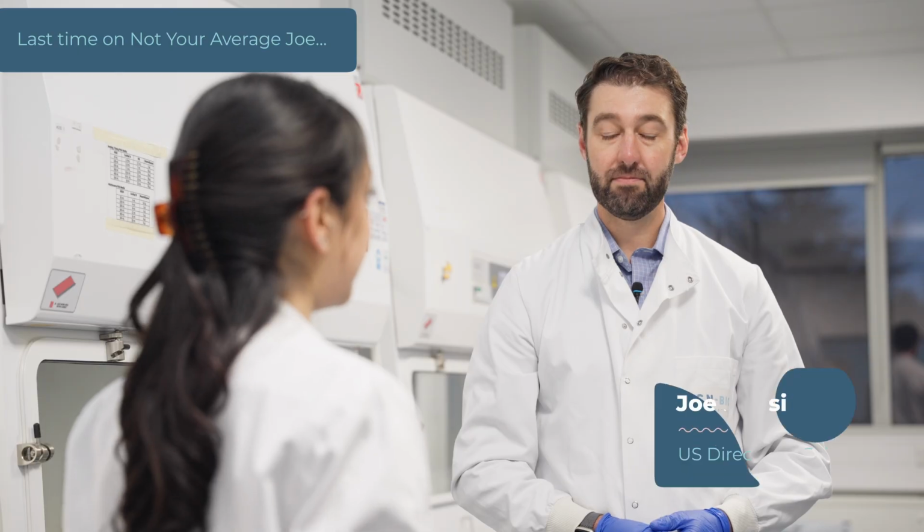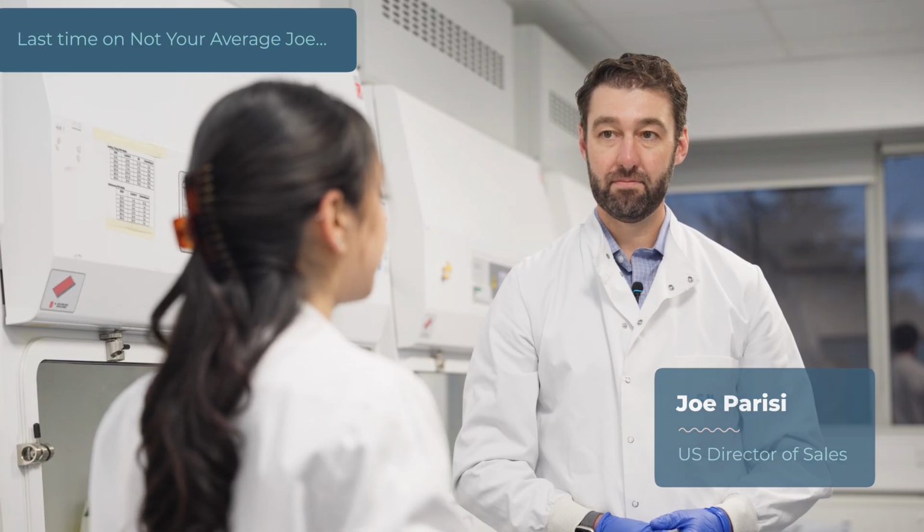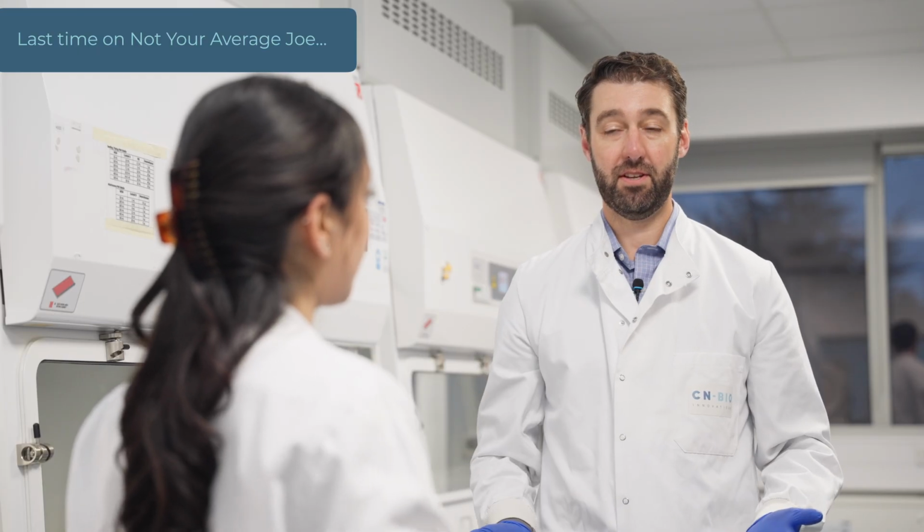So after seeding, we have to wait overnight for the cells to seed, and then we change media into the maintenance media. And after 4 days of maintaining, the cells should start forming microtissues in the pores of the scaffolds. So you can begin dosing at day 4. Exactly.